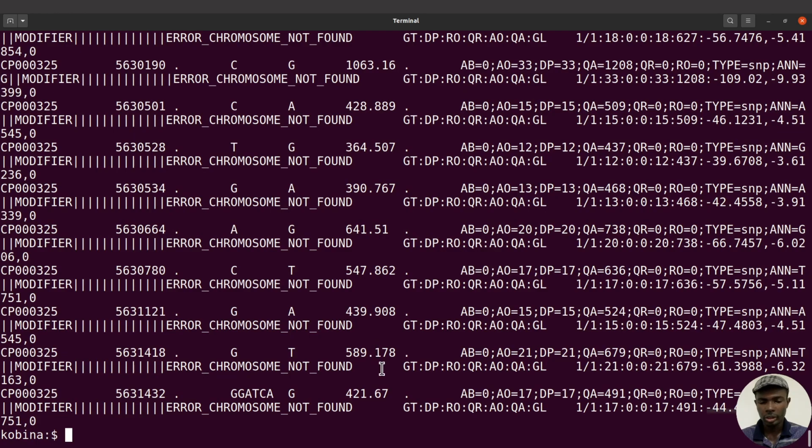Okay, so this happens a lot, and it has got to do with the names of the sequence in the database itself, and then the names of the sequence. So in this case, chromosome. Let me just go over again. One of the common issues when you are running SnpEff is this one here, error chromosome not found. This has got to do with the names of the chromosomes in the database and then in your VCF file. So if there are inconsistencies, then you have this message coming up.